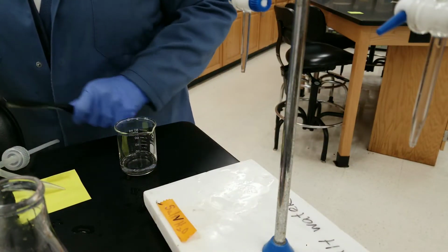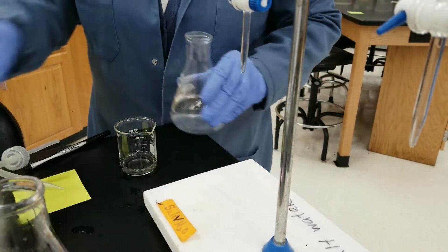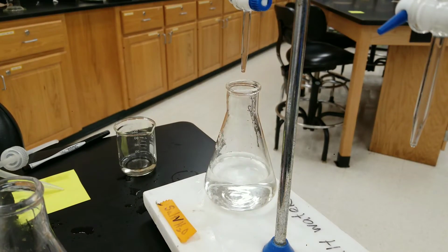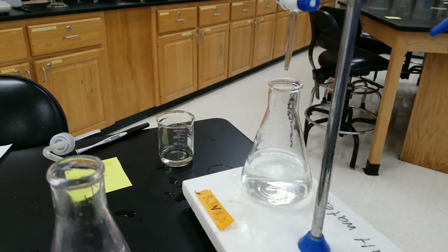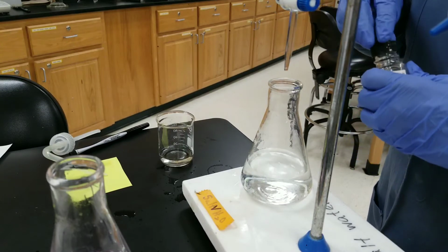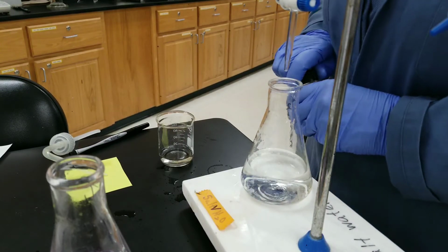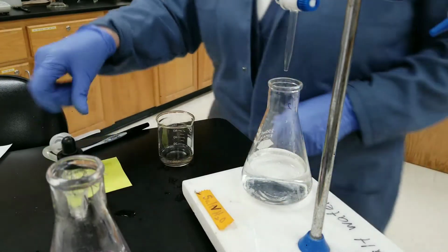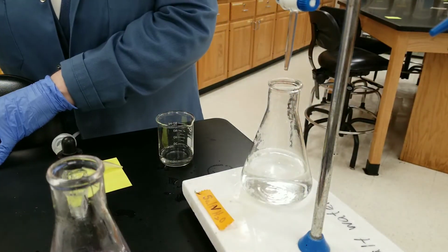And trial 2, I'm going to do the same thing. 1, 2, 3. And we can pretty much use 23.90 as our initial volume for trial 2.